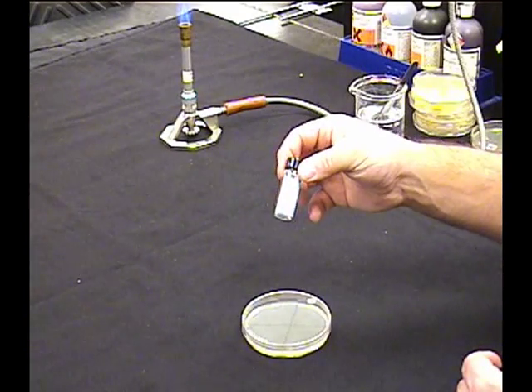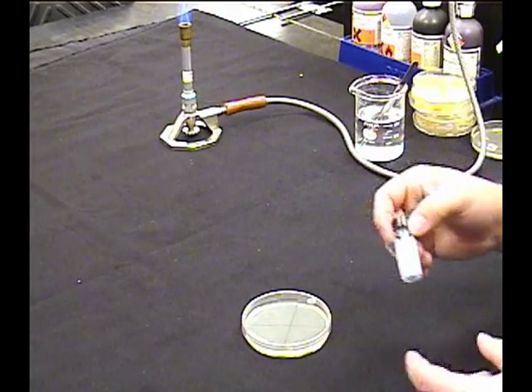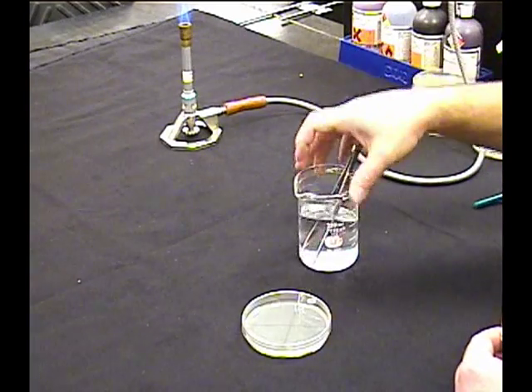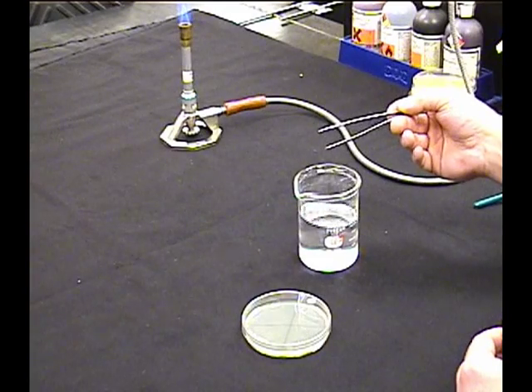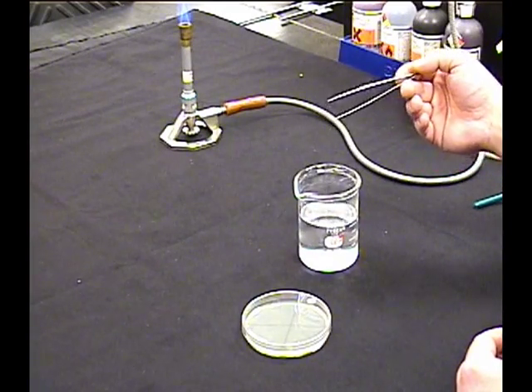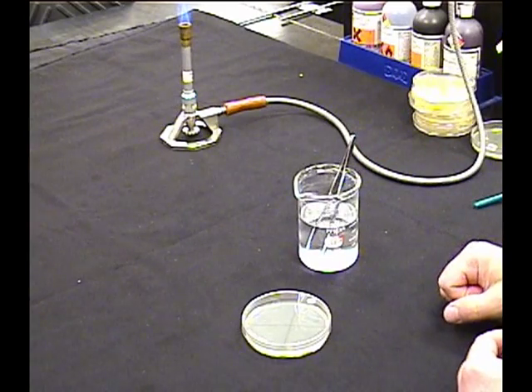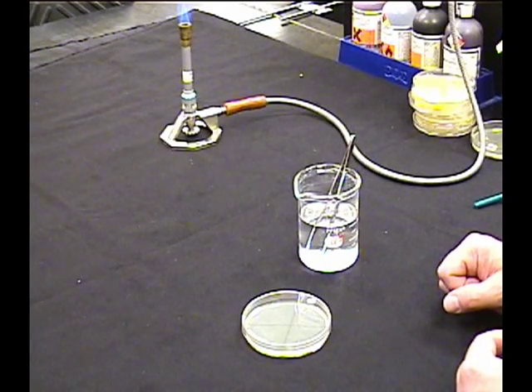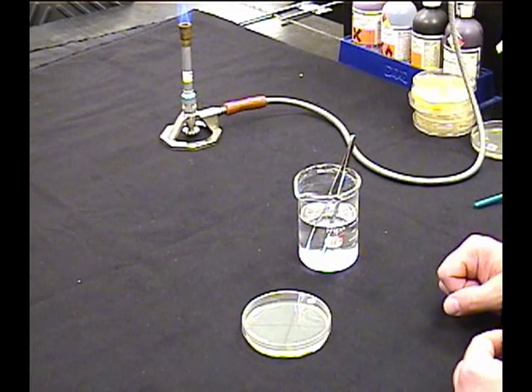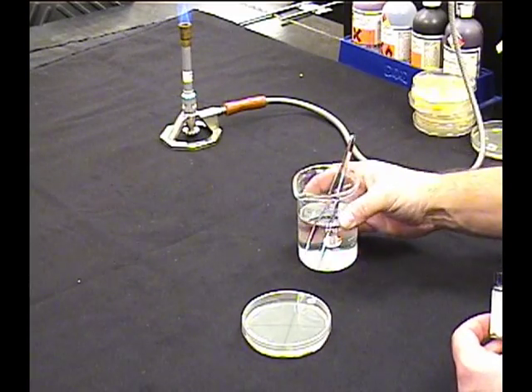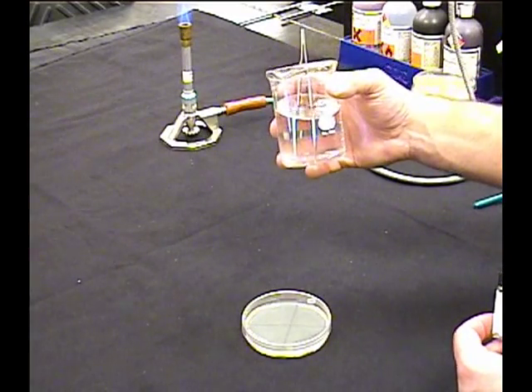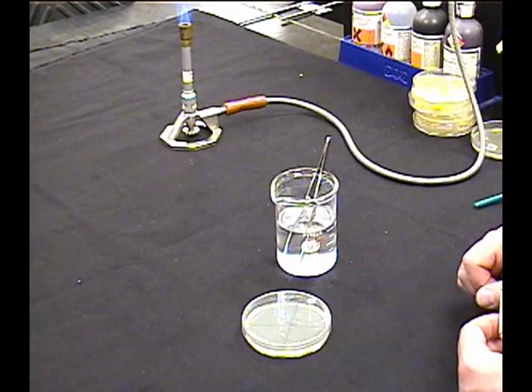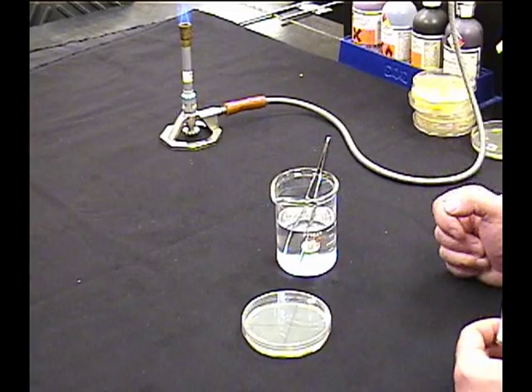The problem is these are sterile. We got to come up with some sterile tool to use. And a loop doesn't work too hot for this. So we're going to use forceps, but forceps need to be sterile too. And you can't really flame these because by the time you make them glow red, they're really hot and you burn yourself and all sorts of other problems. So what we're going to do is this is 70% ethanol. It's denatured ethanol so you can't drink it.